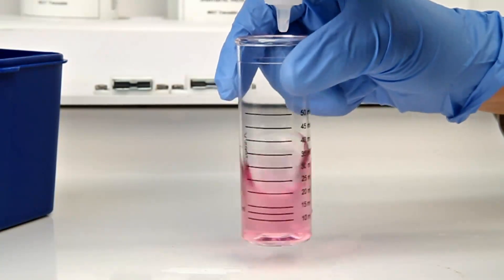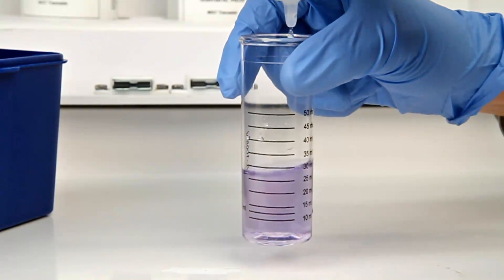According to the Endpoint ID procedure, the titration is complete when the sample has changed from red to blue.